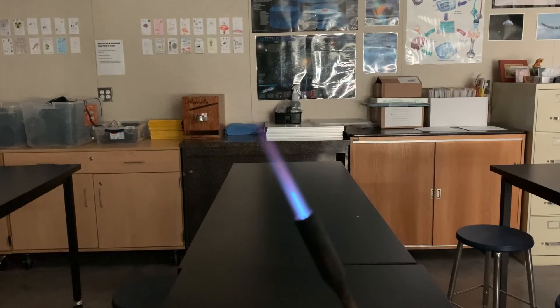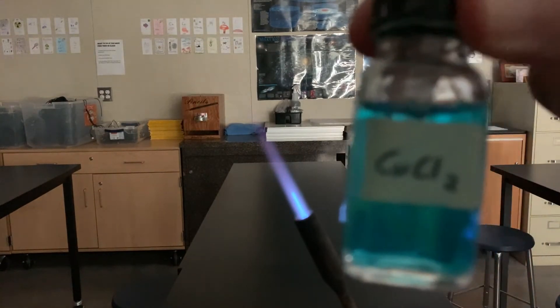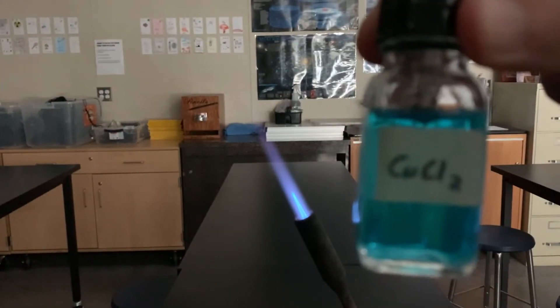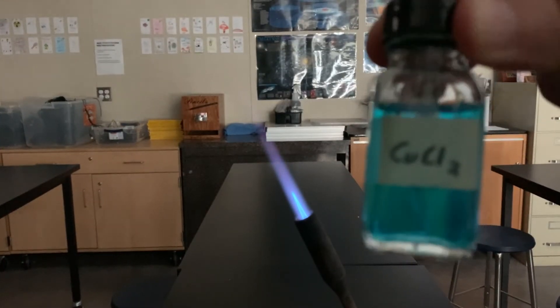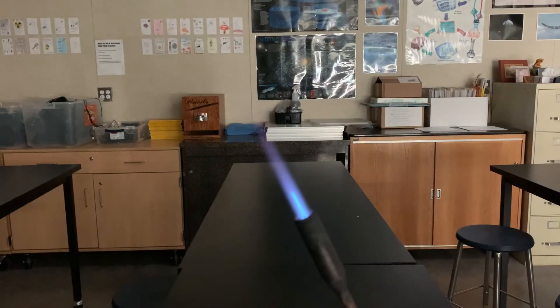Another one of my favorites is copper chloride. It makes a beautiful bluish liquid.